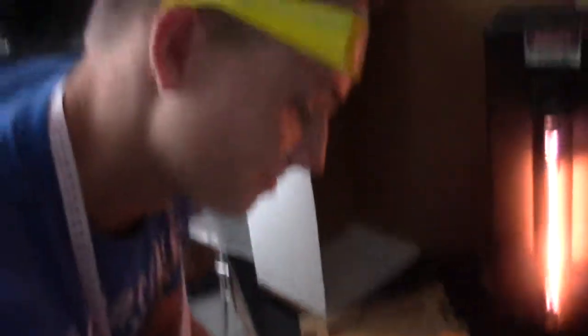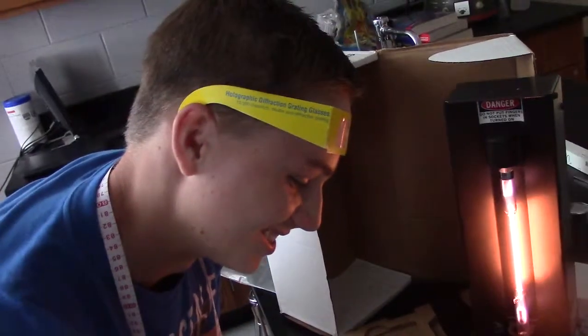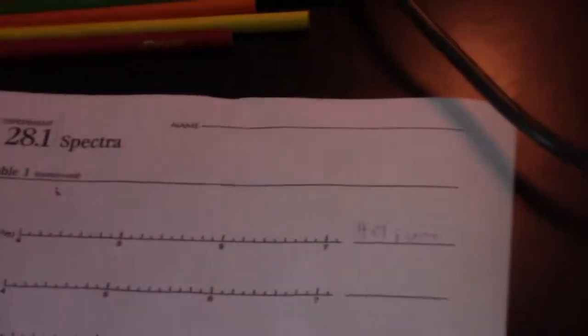So the first one we're doing is helium, so Sam would you write helium down right there? Any day that Sam actually writes down helium, that would be great. Totally wrecking this video, amateurs, I can't get a professional. So apparently all the colored pencils are dull. You might want to work on that before you start your lab tomorrow.